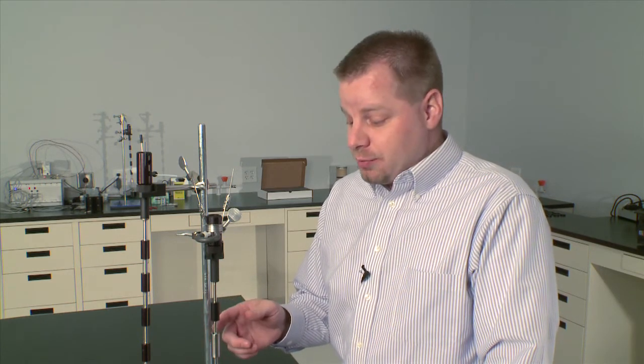Now you have your relative humidity chambers full on your RH ampoule and you're ready to perform your experiments. Remember, after you're done with your experiments and you're ready to pack up the RH perfusion ampoule, make sure to empty the relative humidity chambers before putting it back in the box and storing for any amount of time.